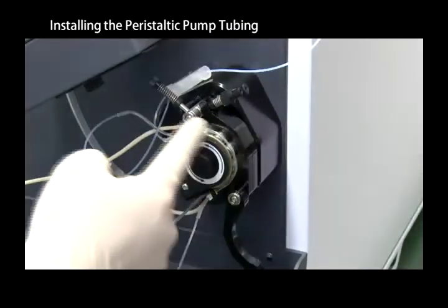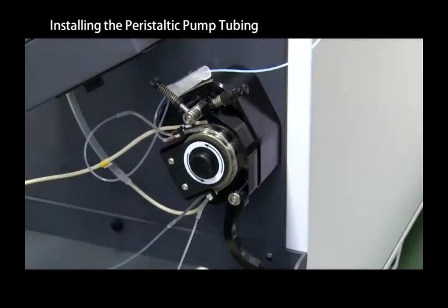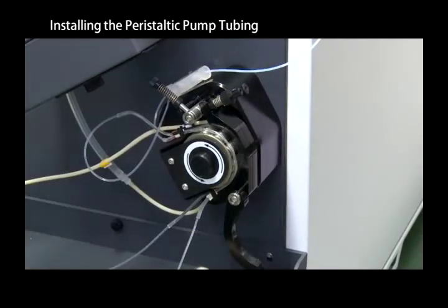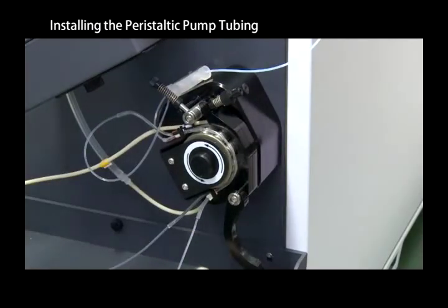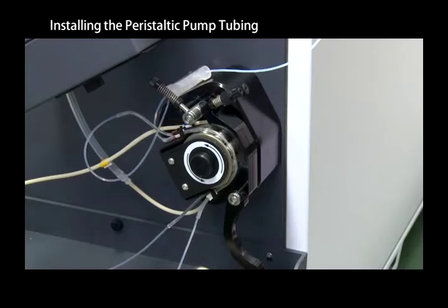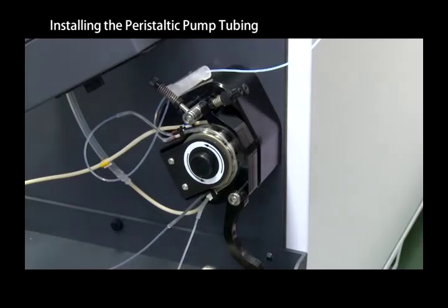Recheck the direction of the peristaltic pump rotation and confirm that the sample flows toward the nebulizer. Finally, close the tube clamps.